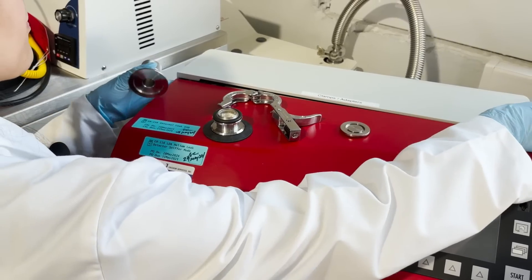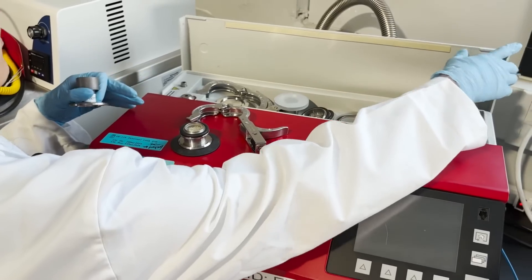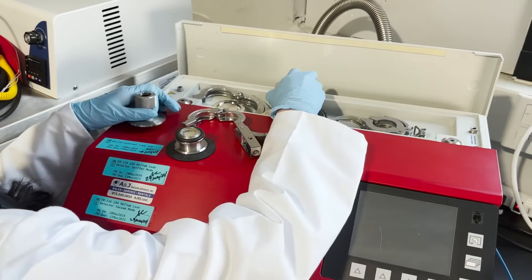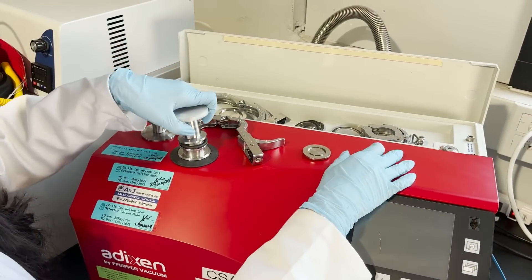That section of USP Chapter 1207 is directly tied to packages maintaining sterility. The helium leak testing is sensitive enough to evaluate the maximum allowable leakage rate beyond this, making it suitable for evaluating most container systems.